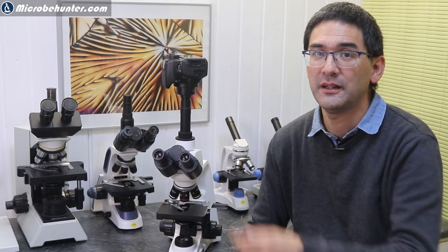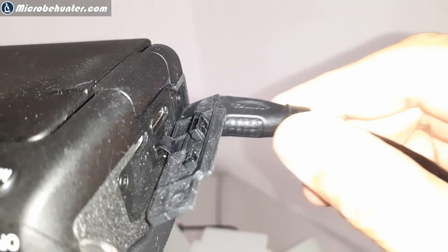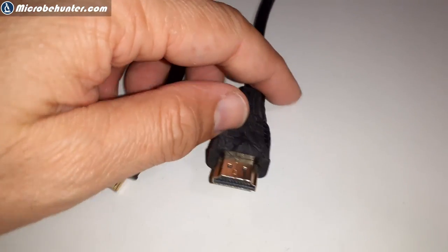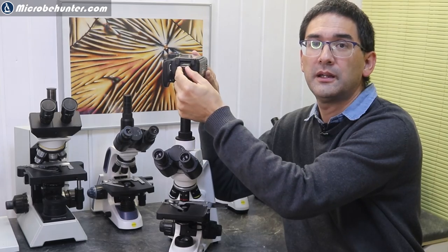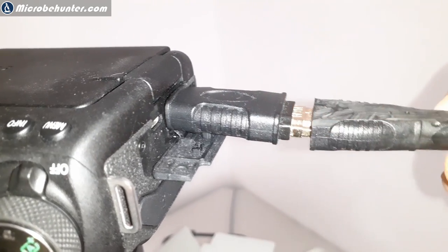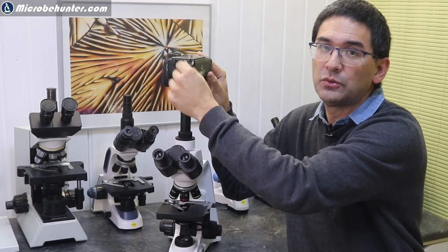When connecting the camera to a screen, the HDMI connector on a DSLR camera is a small HDMI connector, whereas many monitors have a large full-size HDMI connector. There are two solutions: either you buy a cable with a small HDMI connector on one side and a full-size one on the other — which is what I recommend — or you use a small adapter like I have here. I don't recommend the adapter approach because it's inconvenient, bulky, wobbly, and may stress the plug. I recommend getting a cable to connect directly to the monitor.